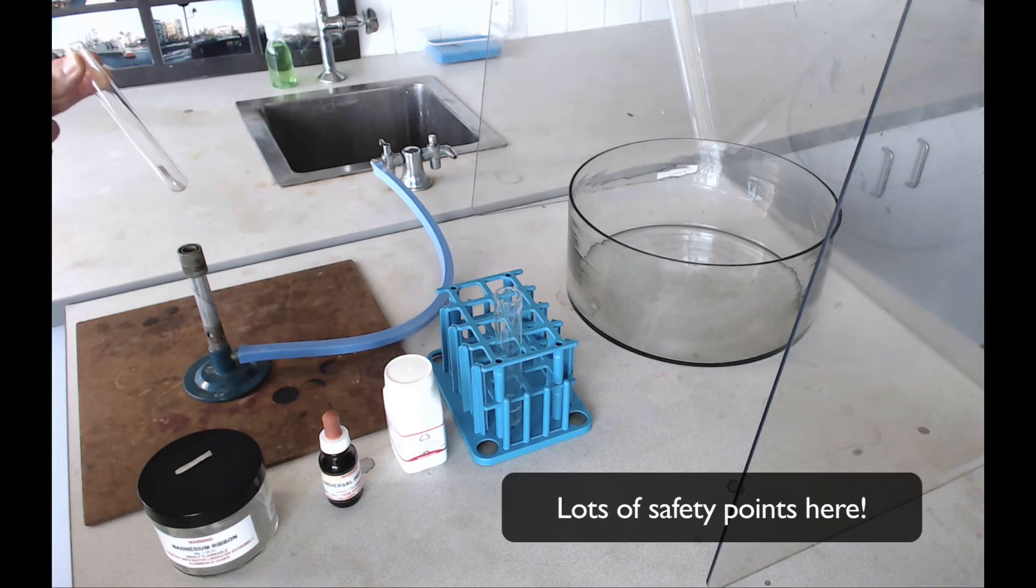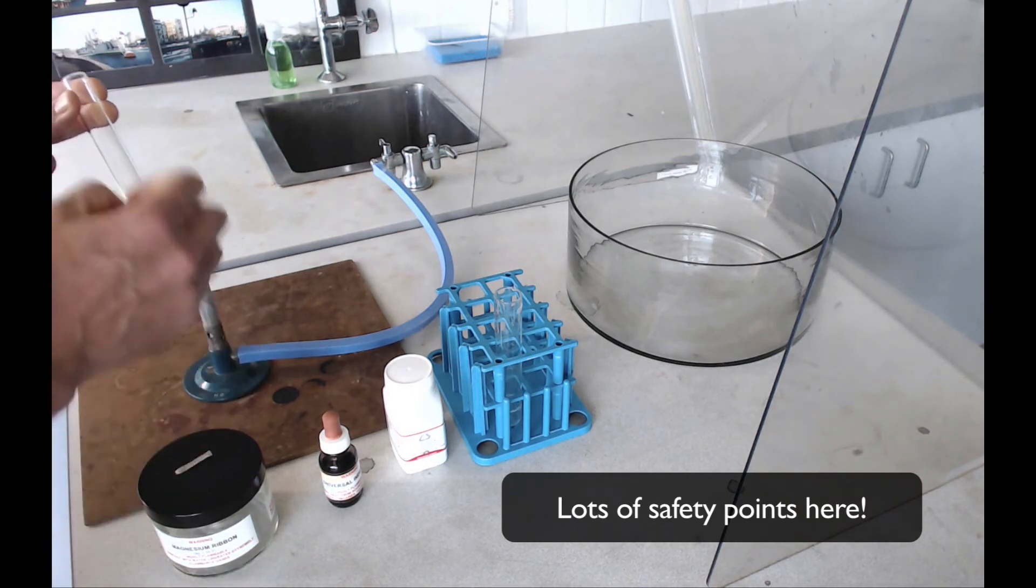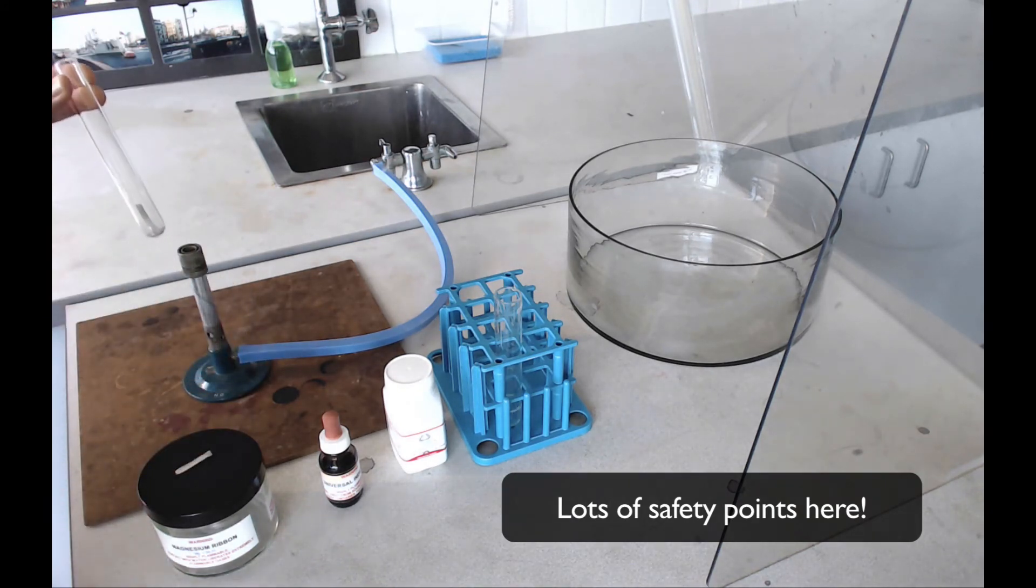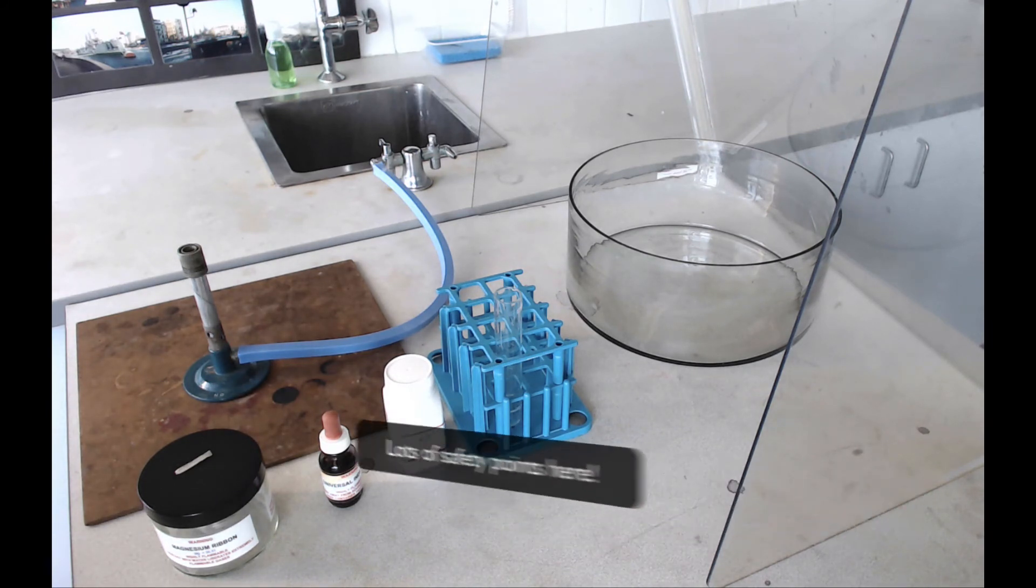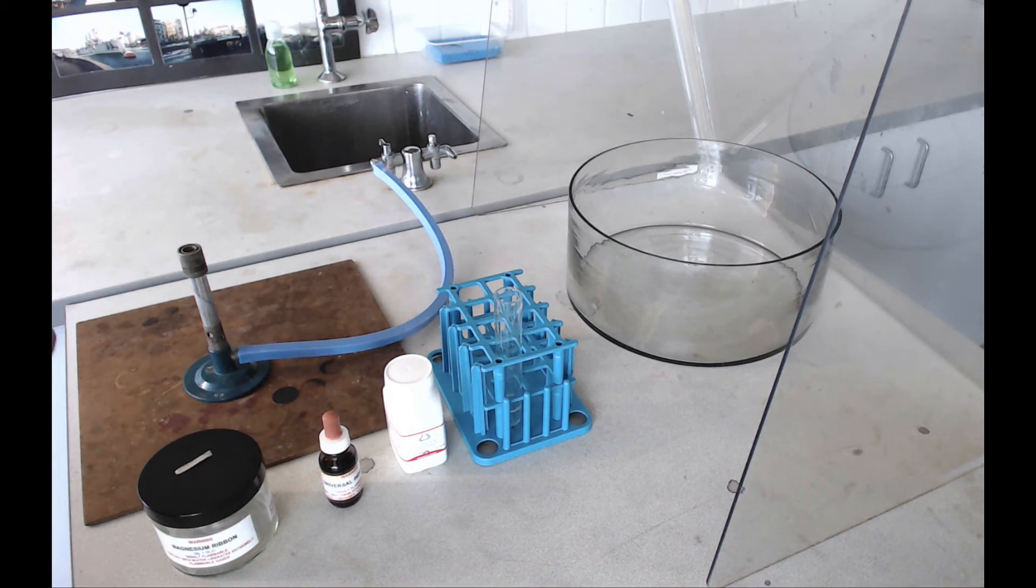If you keep heating after that, the water will just boil quite violently and shoot out of the tube. So make sure you're always pointing this tube away from yourself and from other people while you're heating it. Be especially careful if the lab is a bit crowded. Once the water is about to boil, so the tube is vibrating, just take the tube out of the heat, and you should observe a reaction starting to occur, even if you couldn't see it in the cold.